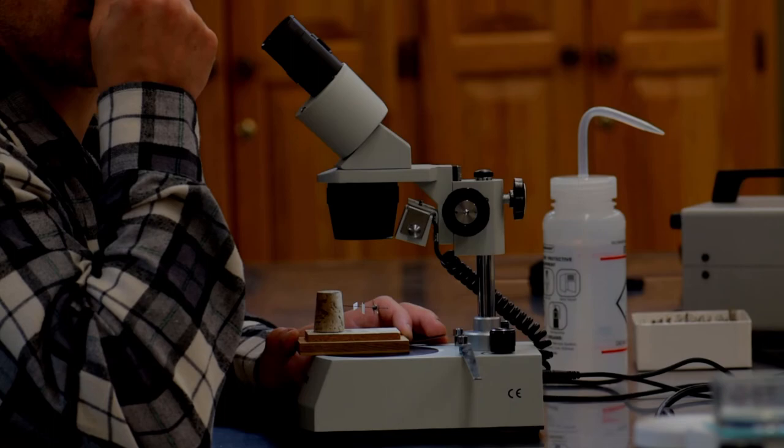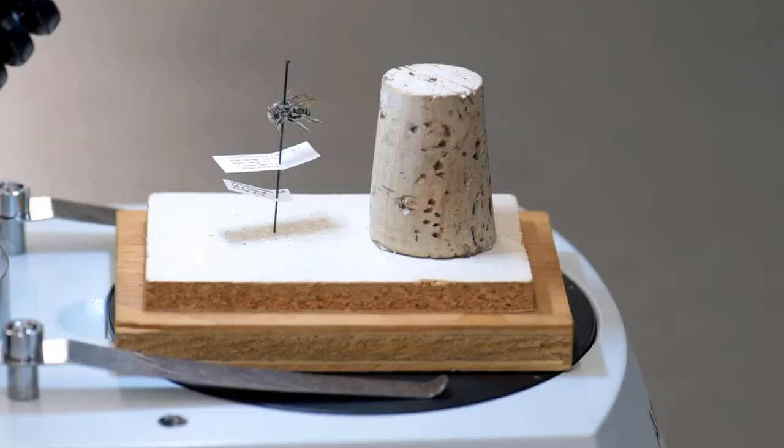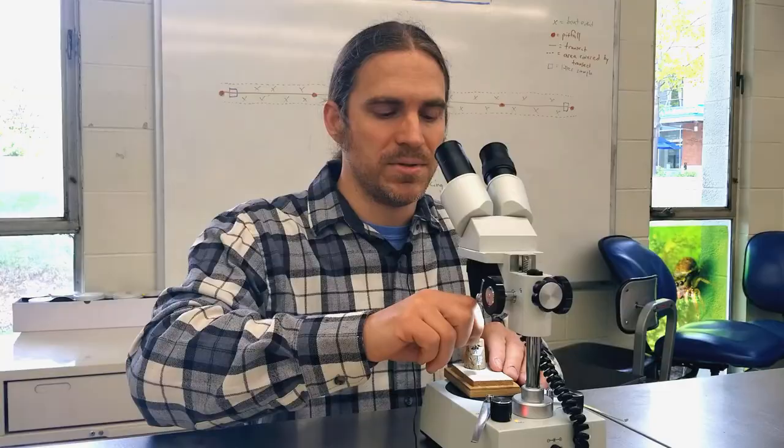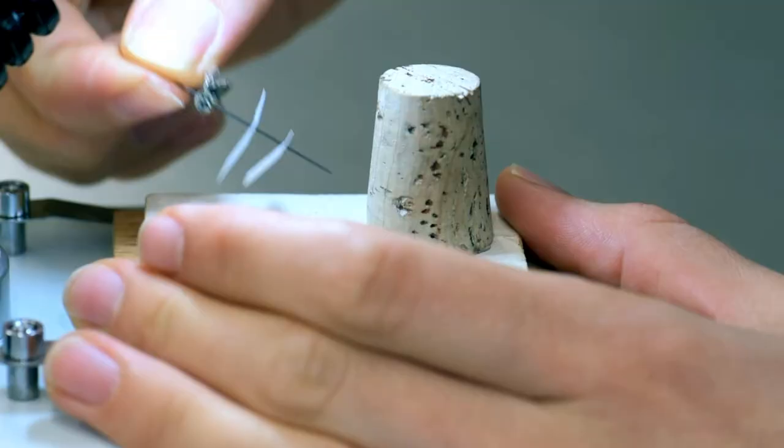When looking at an insect to identify, you often have to look at it from multiple different angles to see different characters. You can't look at an insect and see bits of the wing and also bits of the leg in the same view. My favorite tool for manipulating specimens is a simple cork block. To look at a specimen from on top, put the pin into the cork block. To see it from the side, put the pin into the cork sideways.